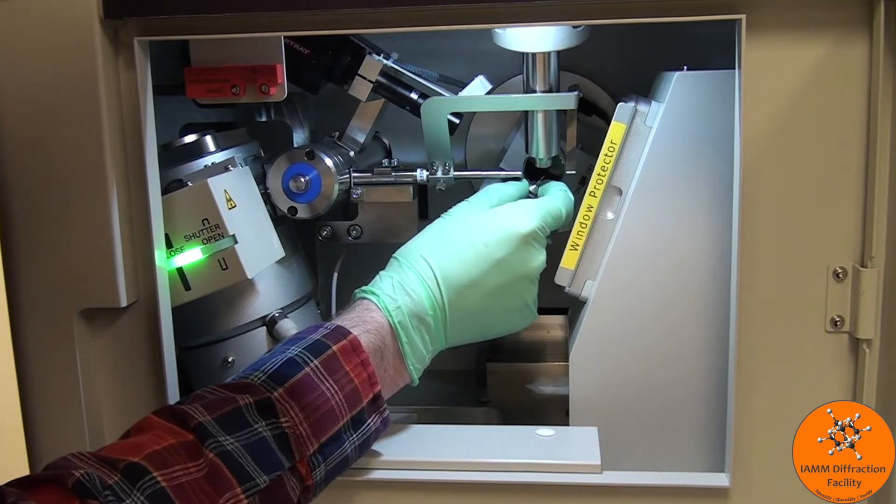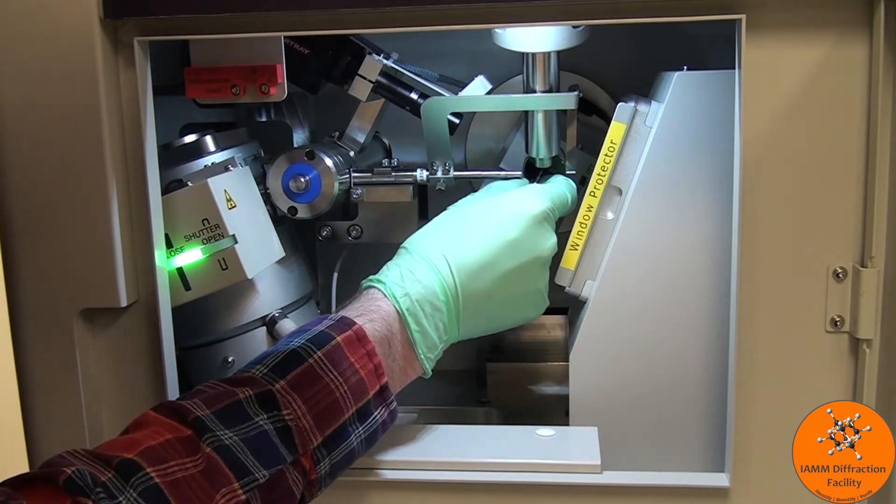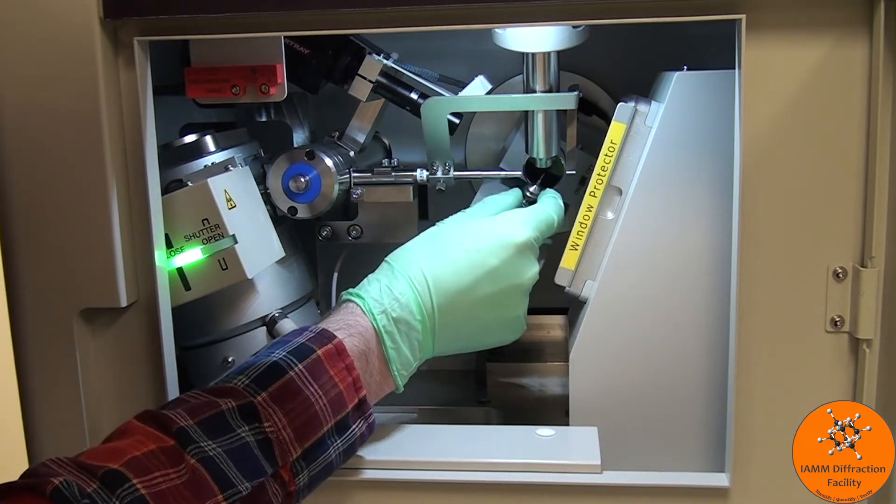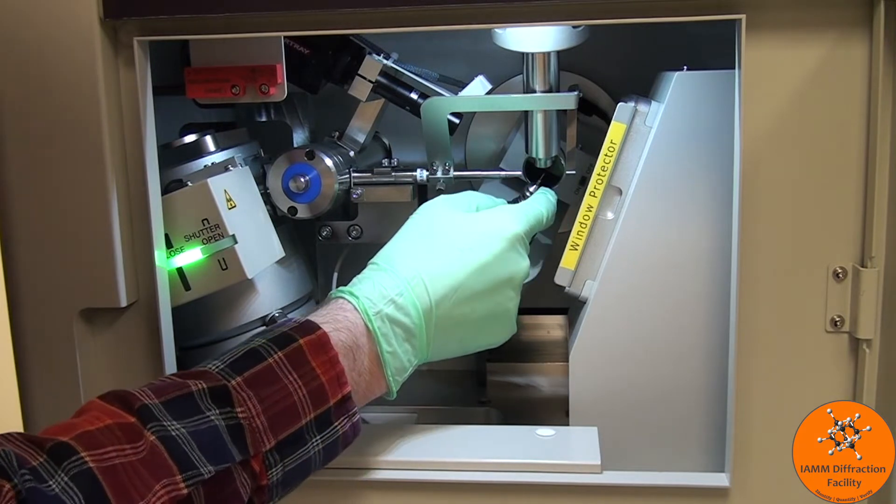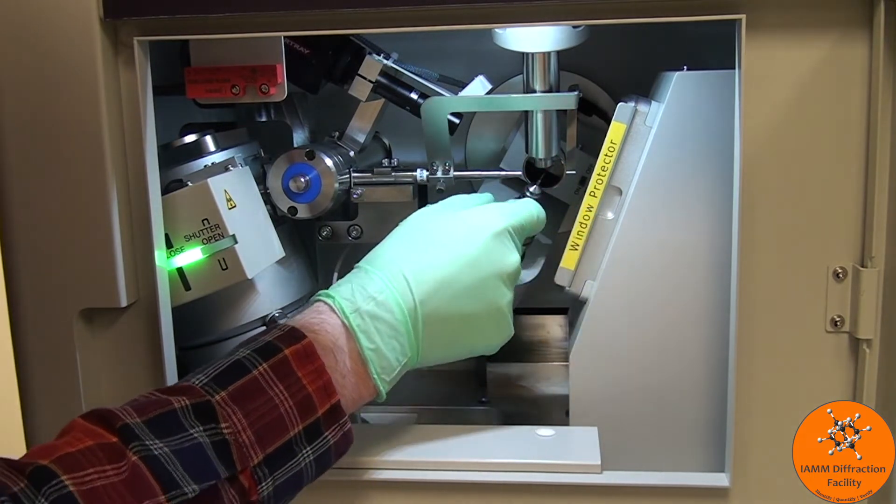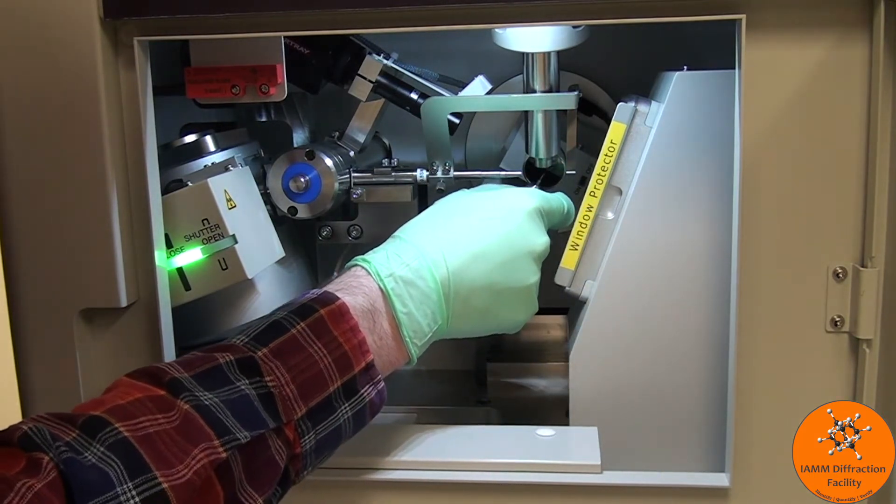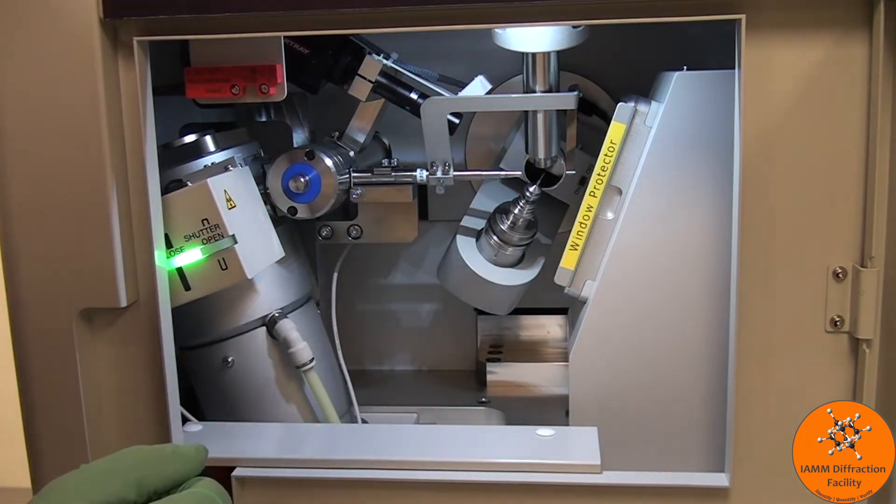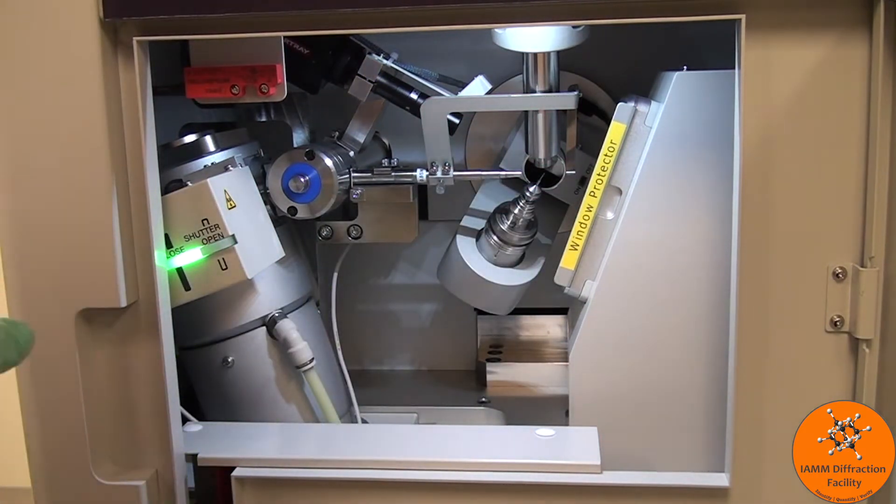With such a small crystal, you will definitely lose it. There we go. You see why we need the detector window here, because we are so close to it, we don't want to bump into it with our fingers. Now that that is installed, let's go over to the computer.